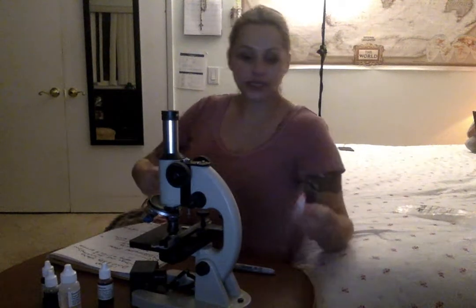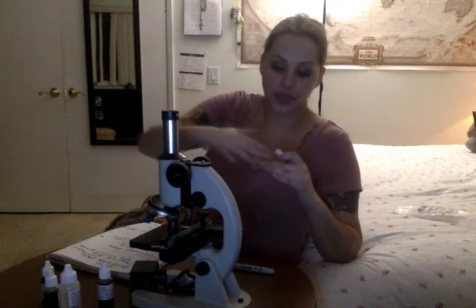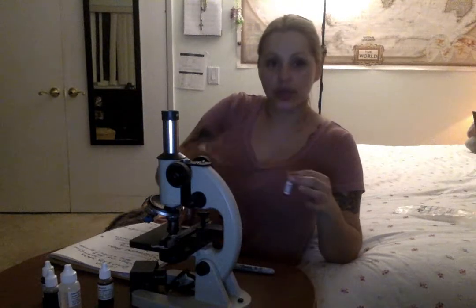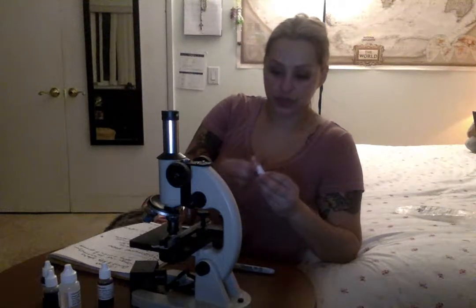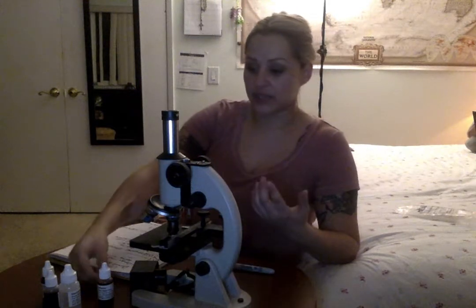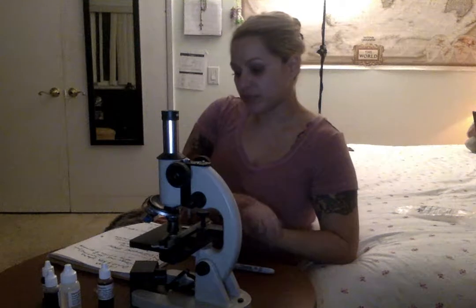With the Congo red, it's a different technique. After you smear it, you put the Congo red and then you take another slide and smear it across or on top of your cheek swab smear. Instead of adhering to the actual cells and structures, it goes around them. That's why they call it a negative stain. The best way for me to describe that is like a negative photograph, where you see the opposite of the actual subject. That's the easiest way for me to describe those.